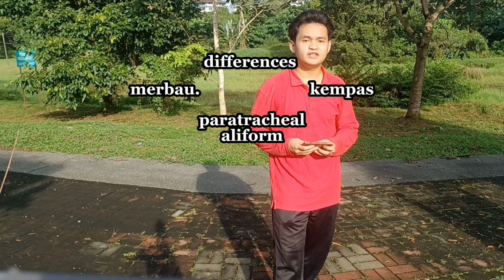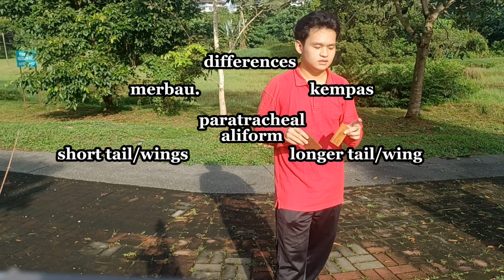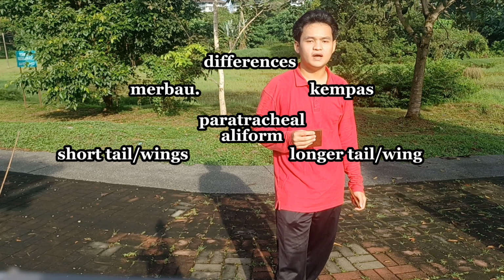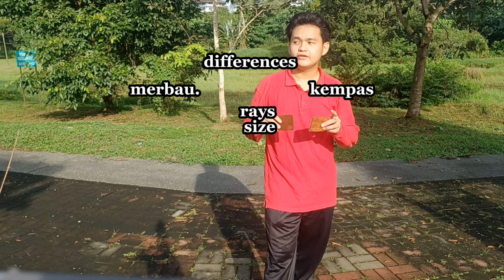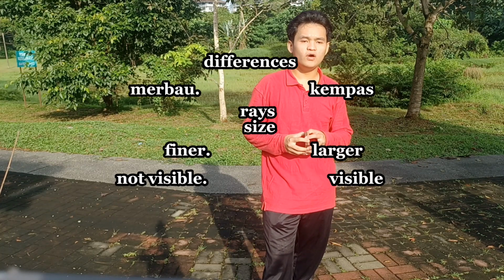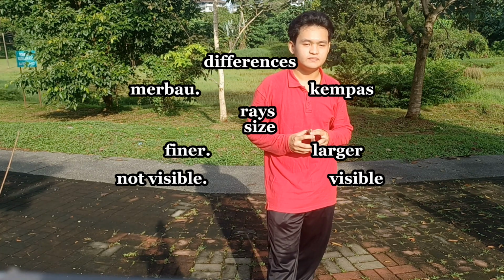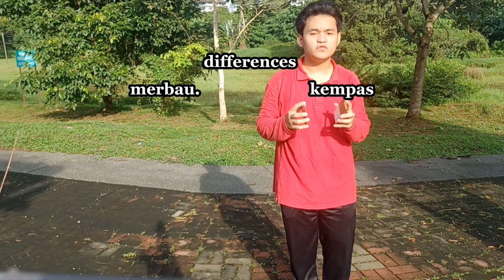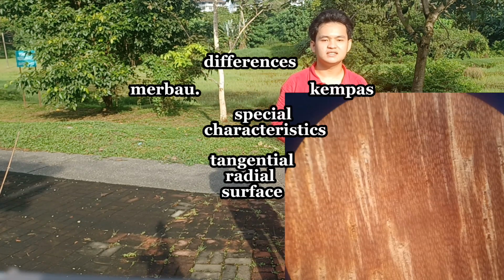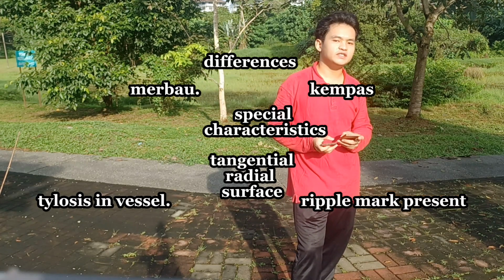And we move on to the parenchyma. For both, it is aliform paratracheal, but the tails of the aliform in kempas are much longer than the tails of merbau parenchyma. If we compare the rays, the rays of kempas are much larger and more visible, meanwhile merbau's are much smaller and finer. Then we move on to the special characteristics. In the tangential section, kempas has ripple marks, almost like chengal, and for merbau, tyloses are present in the vessels.